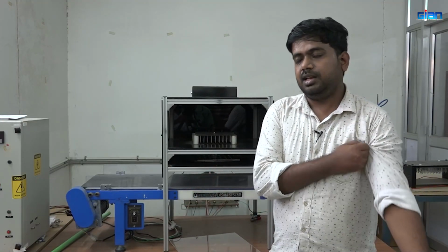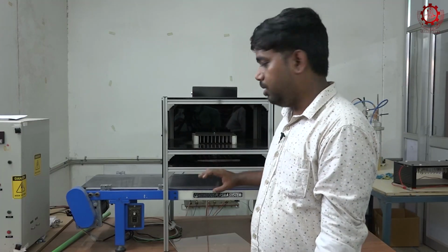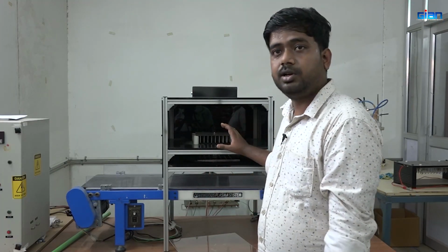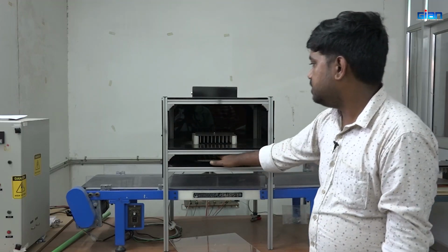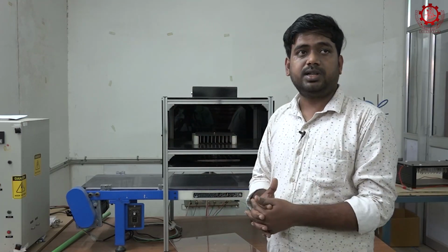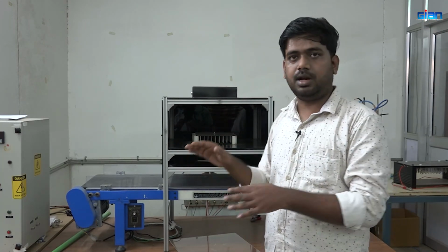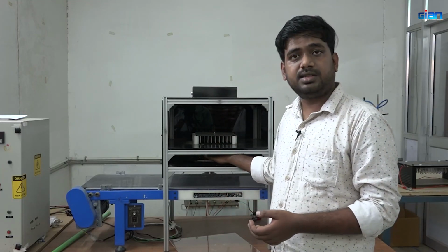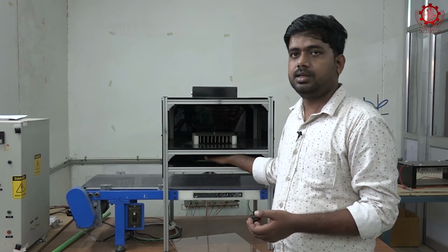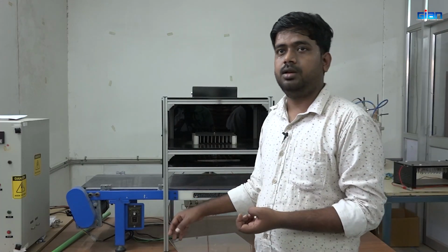It also has certain limitations, because we need a high amount of voltage. For this setup, we can go from a minimum of 1 kilovolt to 70 kilovolt power supply. Another factor is the distance between this electrode and the negative plate. If we increase the distance, we can increase the power also, but the effectiveness of the reactive species will be reduced. Here the distance between the electrode's upper surface and the bottom plate is 7 centimeter and is found to be suitable under voltages between 10 to 20 kilovolt. When we treat the sample, we get better conditions.